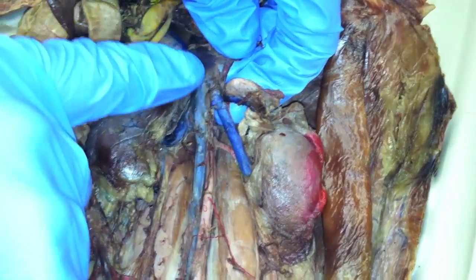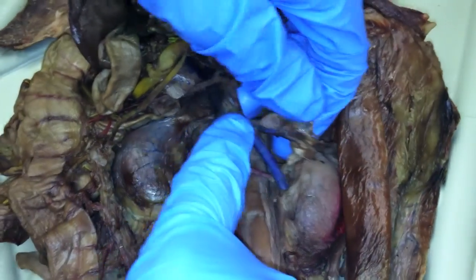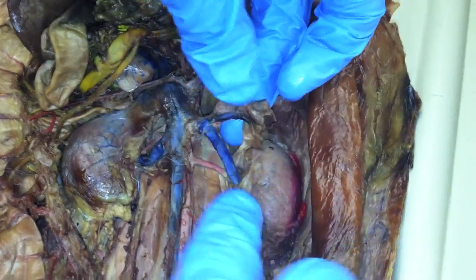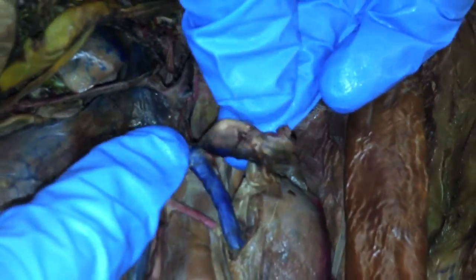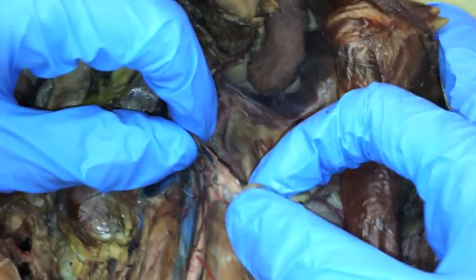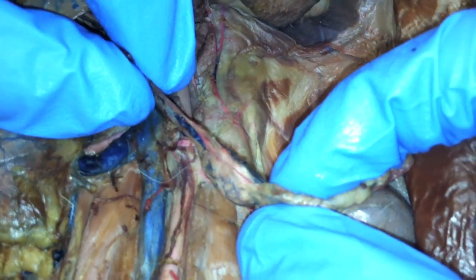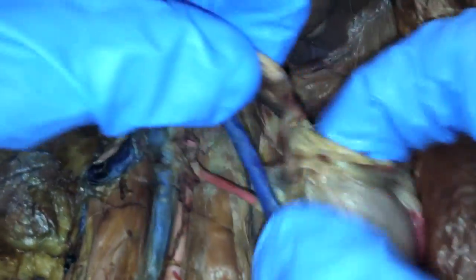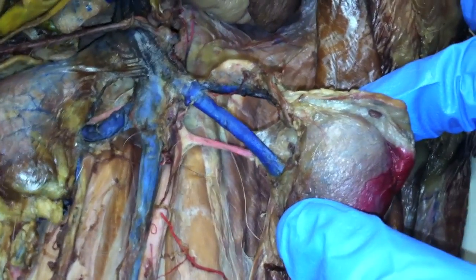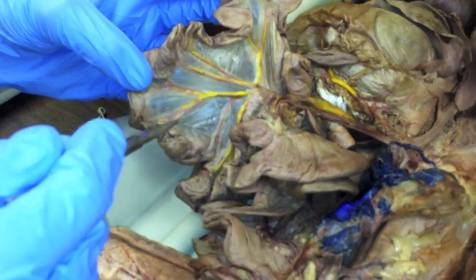The posterior vena cava branches into your renal vein and then your adrenal lumbar vein. And what I'm holding right here is your adrenal gland. So the adrenal lumbar vein runs right past that to the kidney, and the adrenal lumbar artery is right alongside it. The adrenal gland — so that's your adrenal gland. And then your renal artery runs right along the renal vein. The intestinal arteries run through the mesentery, all of those, to the small intestine.